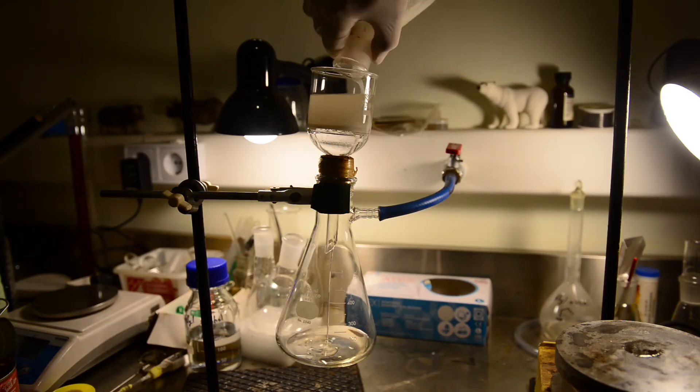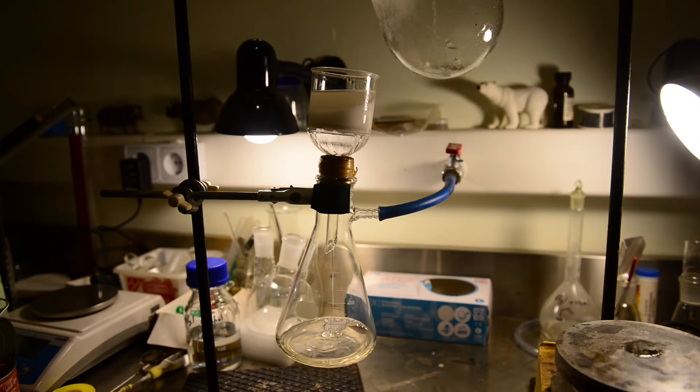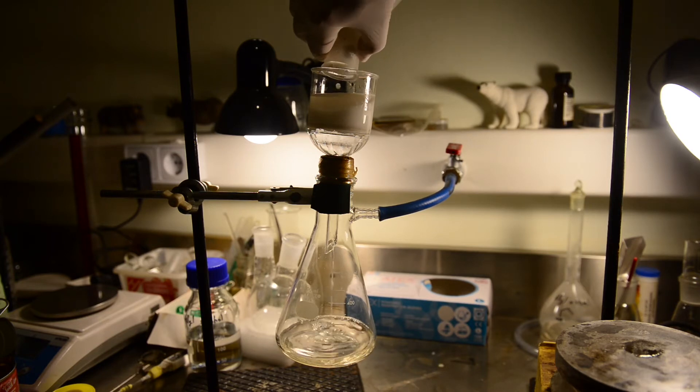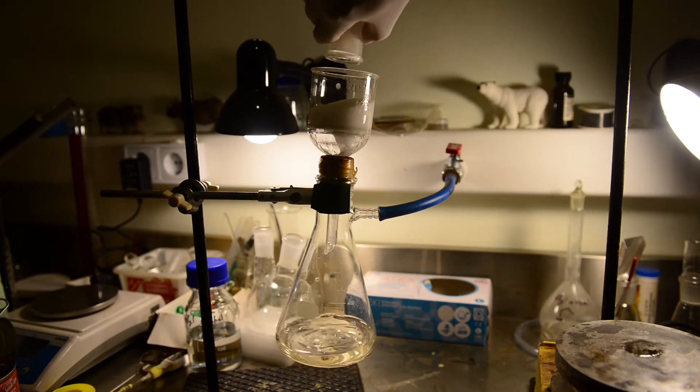but I found out that, it is much better to at first, dissolve the potassium bromide in the water, then chill it down, and only after that add sulfuric acid. On this stage, hydrobromic acid and less soluble potassium bisulfate are formed.